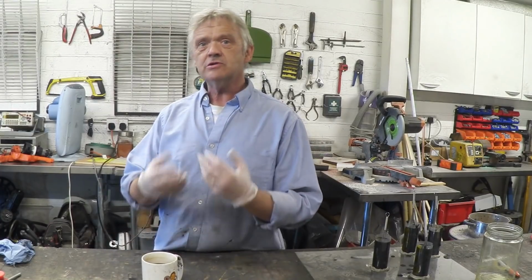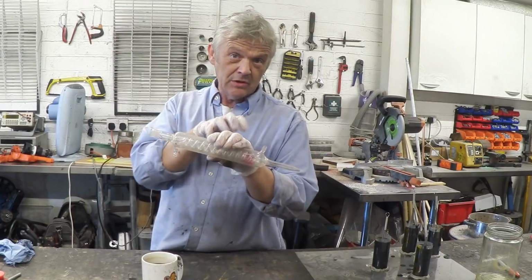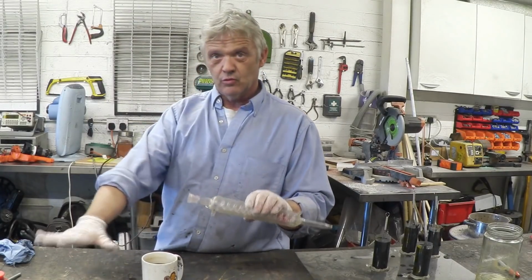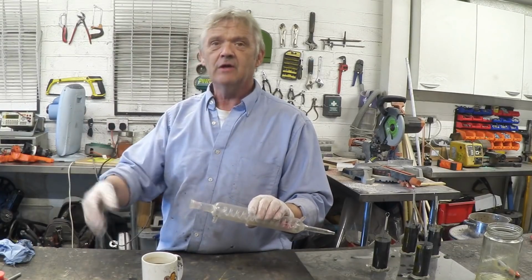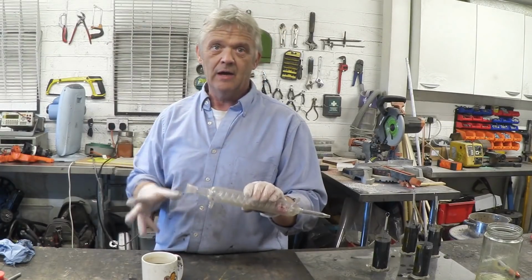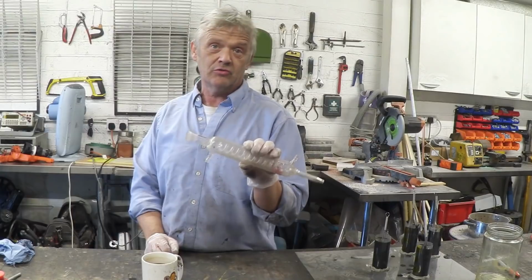So let's say we have a mixture of water and alcohol. The boiling point of alcohol is much lower than the boiling point of water. So if I heat that up, what's first going to come off is all the alcohol as a vapor or a gas. We put that through here, add the water, and that alcohol will recondense and drop out as alcohol with a reasonable amount of purity, leaving the water behind until the temperature goes up. Once the alcohol has boiled off, the temperature will go up to the water boiling temperature, and we'd actually get water coming through there. But we can separate those two liquids using a piece of equipment like that in a process called distillation.